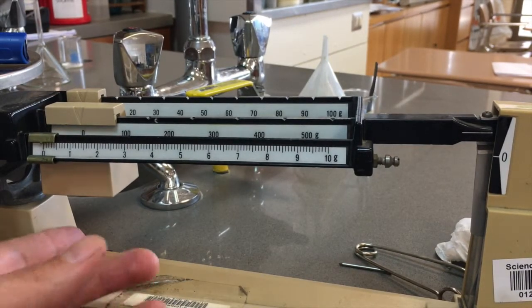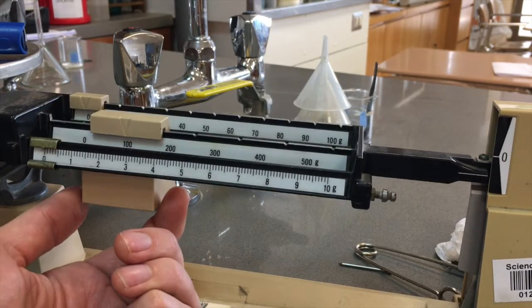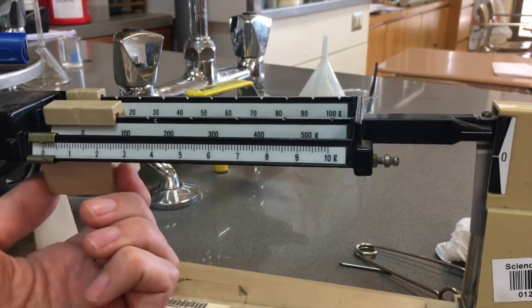So the thing you want to do is try the big slider. Let's see if that works. Nope, you can see it goes down. That's way too much. I want to put that back at zero.